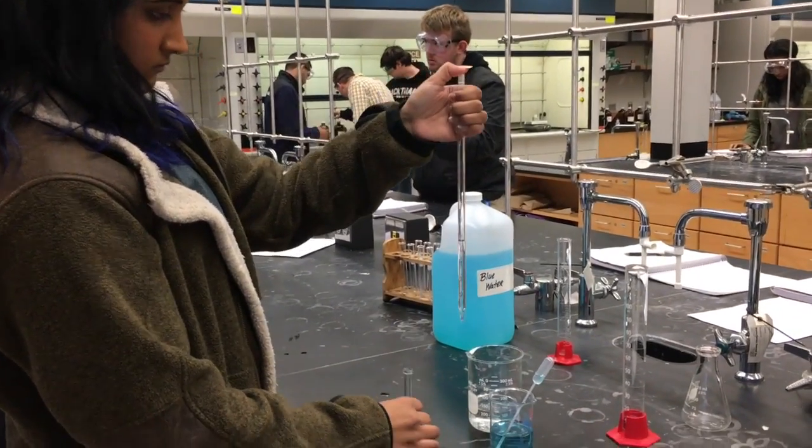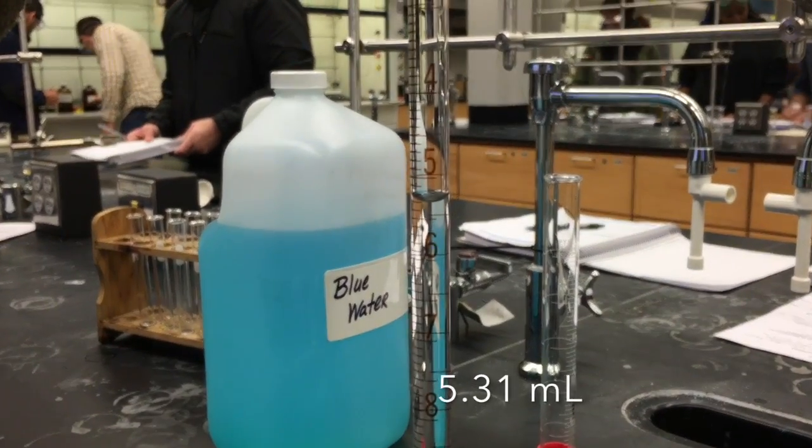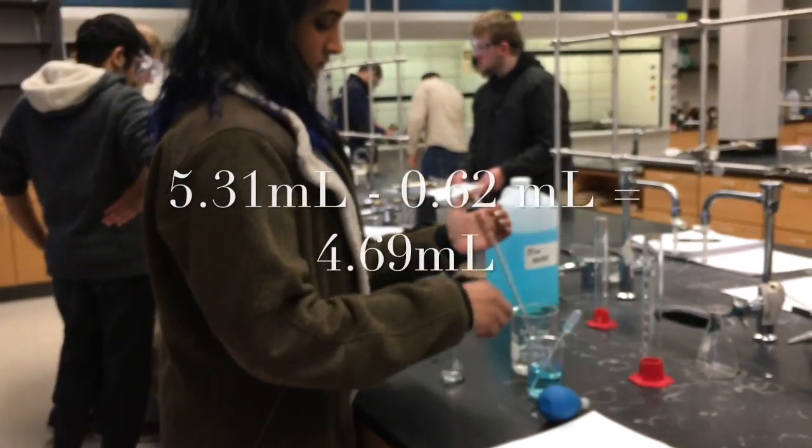The volume of water originally in the pipette is the initial volume. The volume in the pipette after releasing some water into the volumetric flask is the final volume. Subtract the initial volume from the final volume to get the volume of the water that is now in the flask.